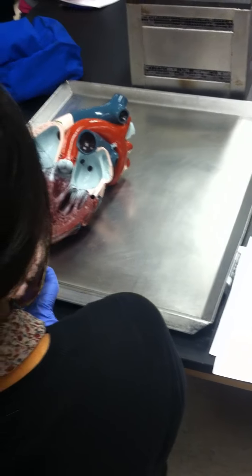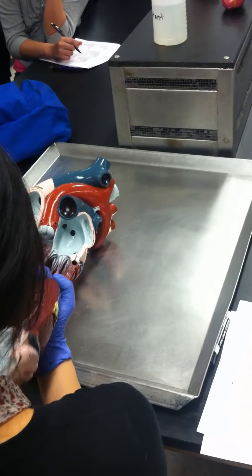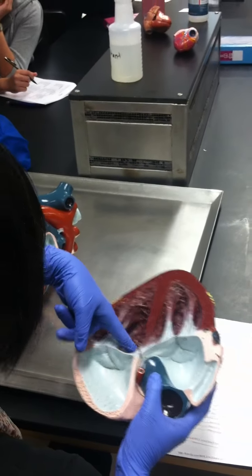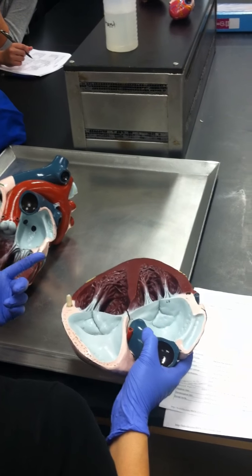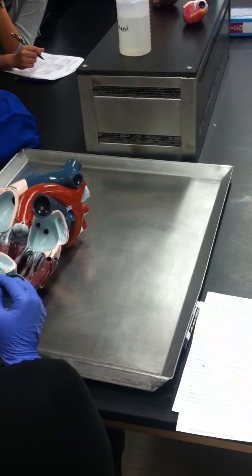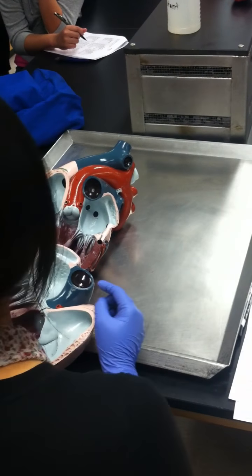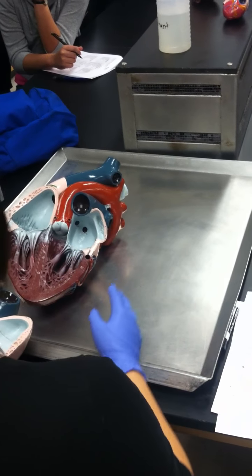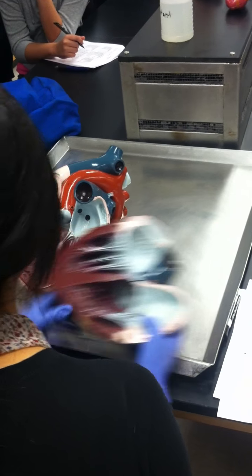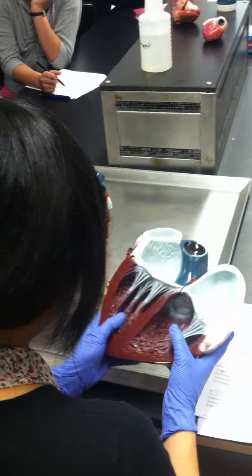Pulmonary, because we have what coming out of it? Trunk. Pulmonary trunk coming out of it, right? Pulmonary valve going to the pulmonary trunk. So if I have this taped, you guys will tell me pulmonary valve. And the pulmonary valve is also known as what? Semilunar. Yeah, remember that? Semilunar. If I give you that question, make sure you know which ones are semilunar and which ones are atrioventricular. Atrioventriculars are the ones dividing the atrium and the ventricles. Remember? We talked about that. Okay, good.